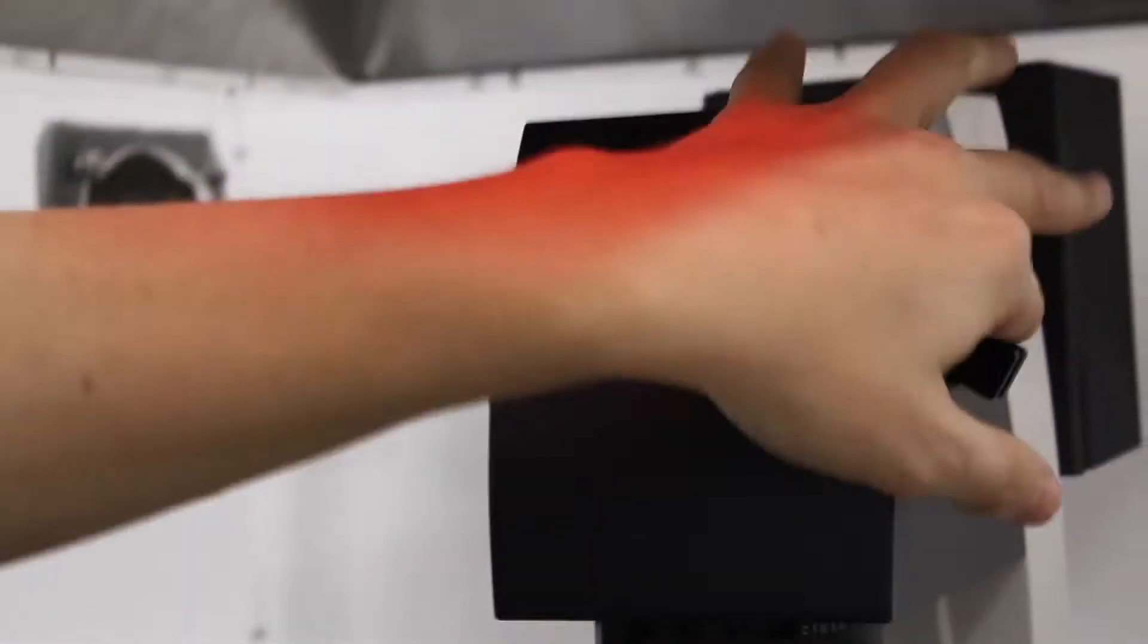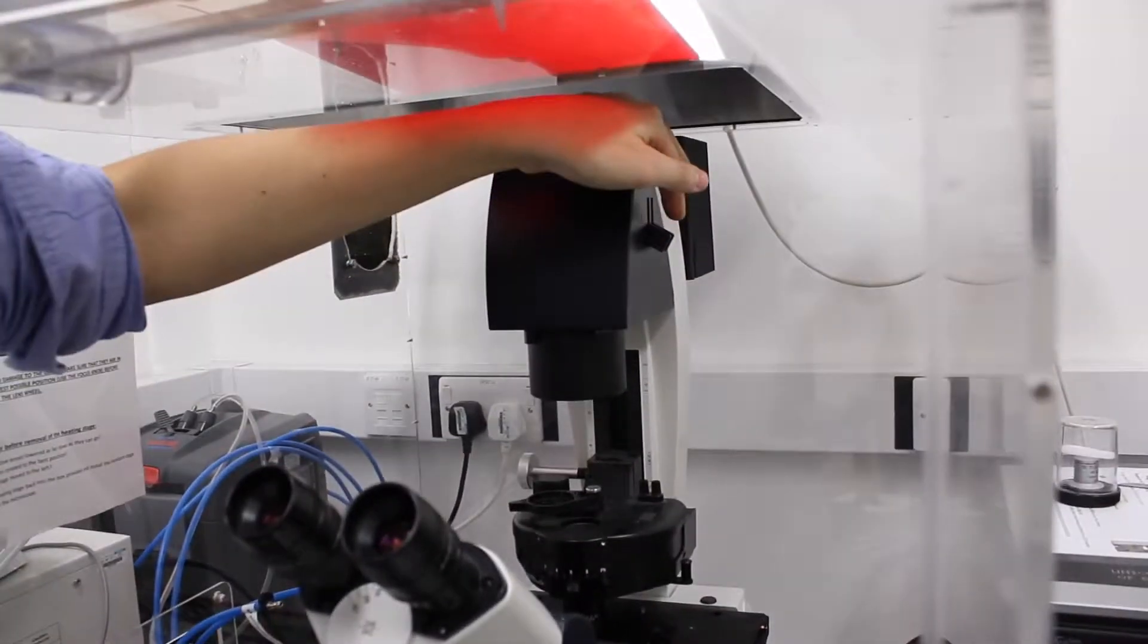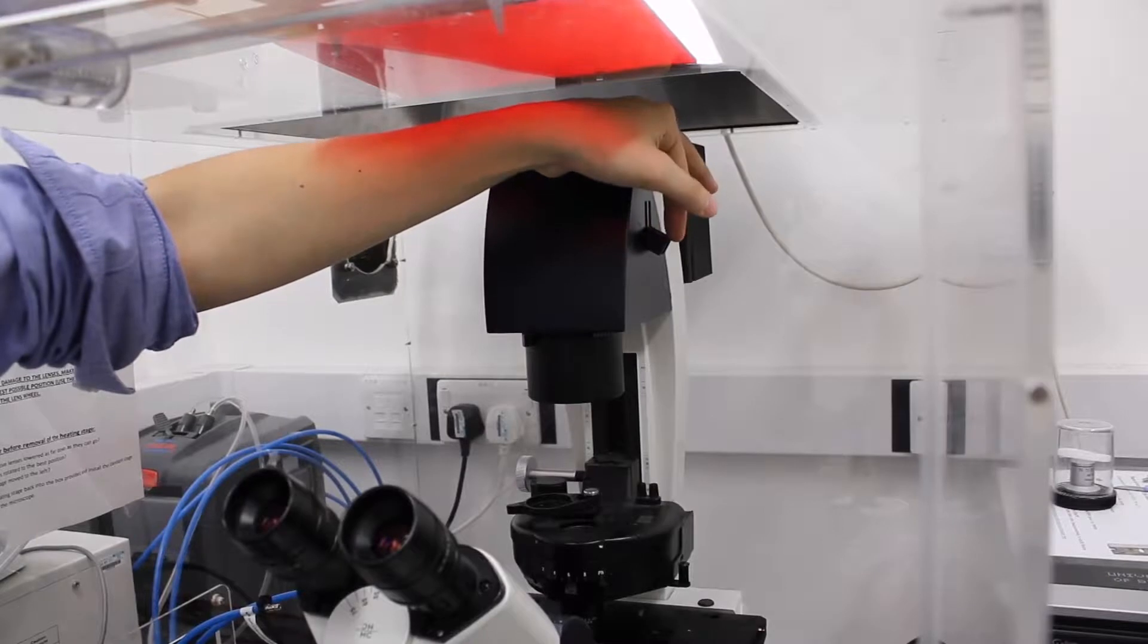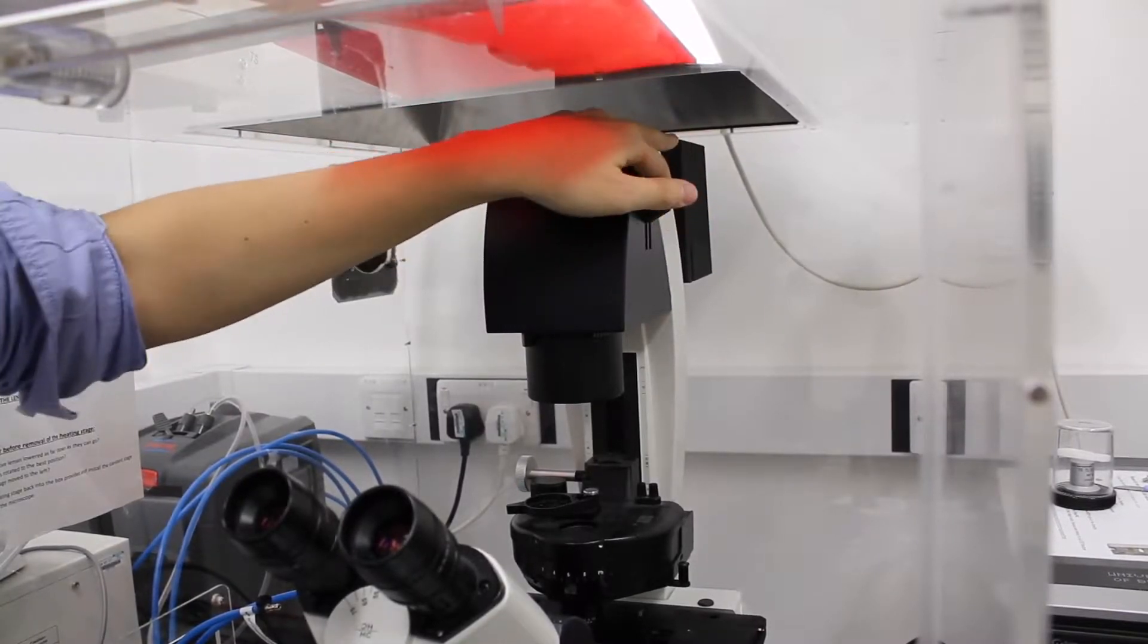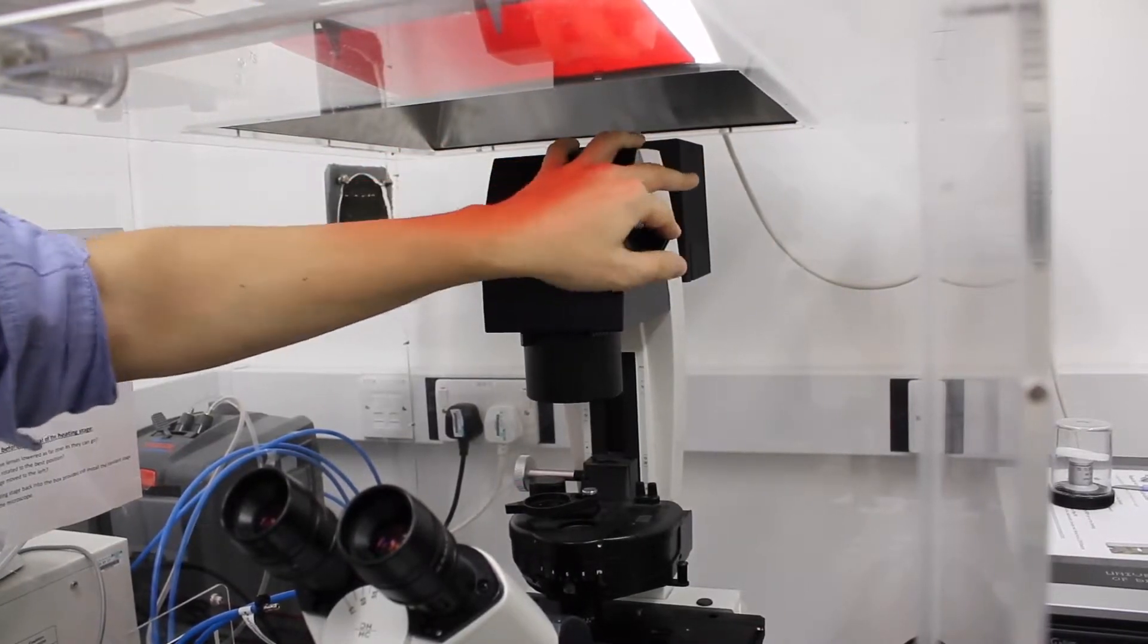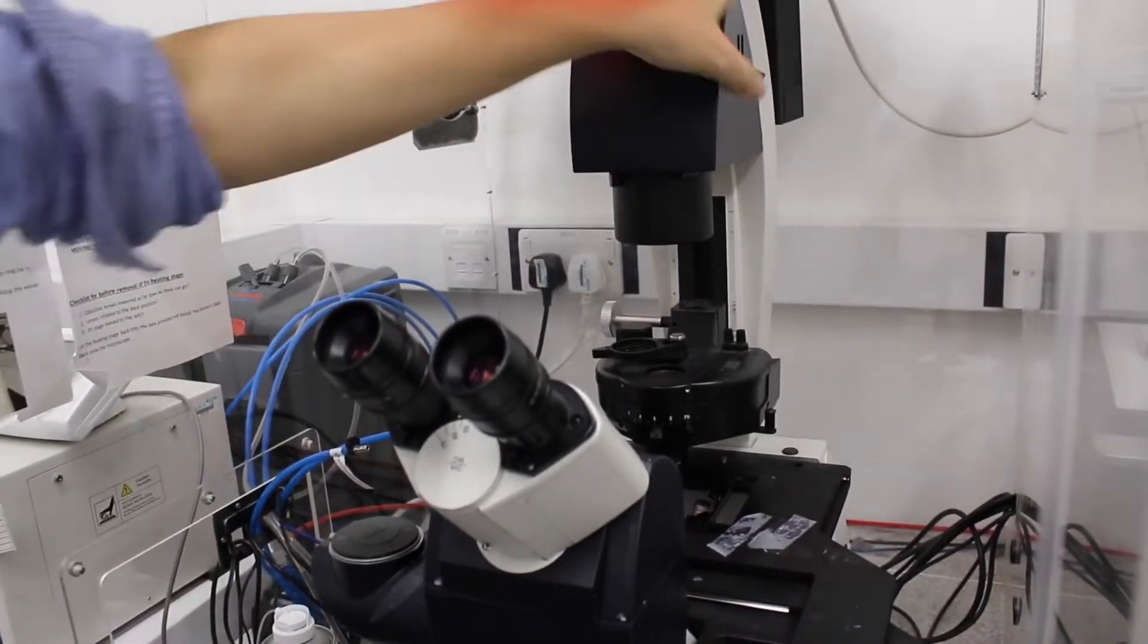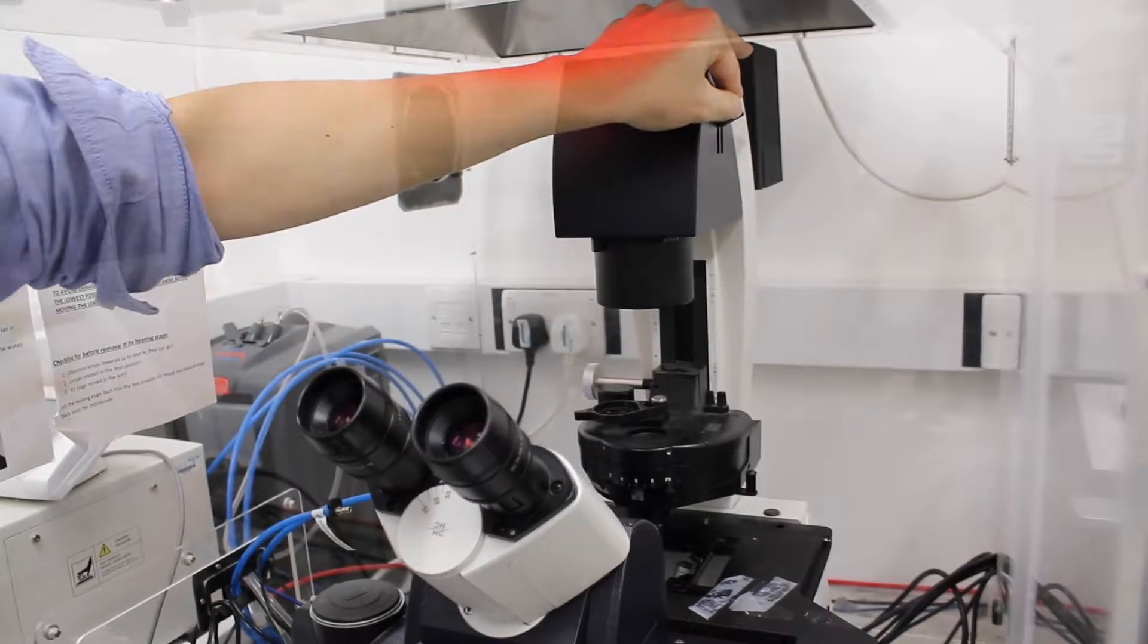And there is also here a shutter that will close or open the light. There is only one of two that is working, the other one is just empty. That's just a shutter. It's not turning off the lamp, it's just closing the Brightfield lamp going to the sample. So when you're doing fluorescence measurement, you can just close the Brightfield with that without turning off the lamp.